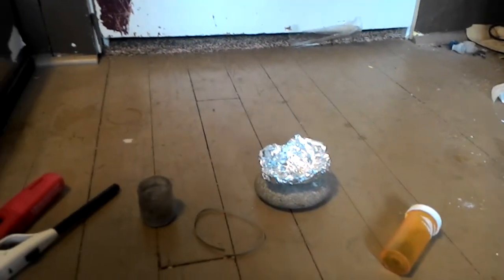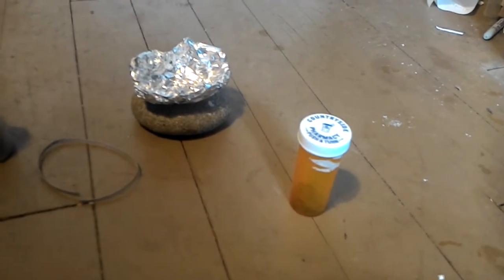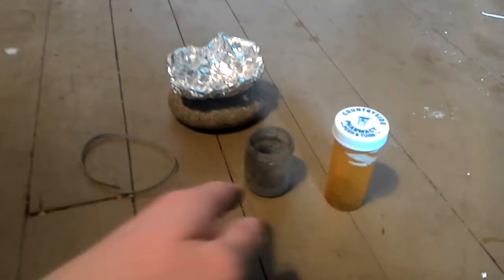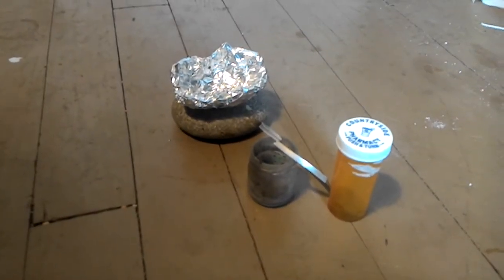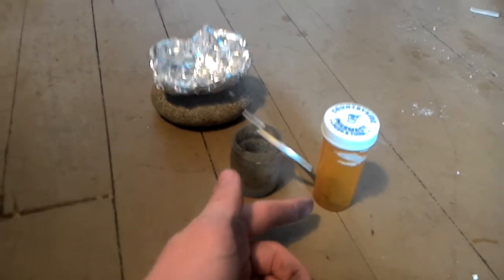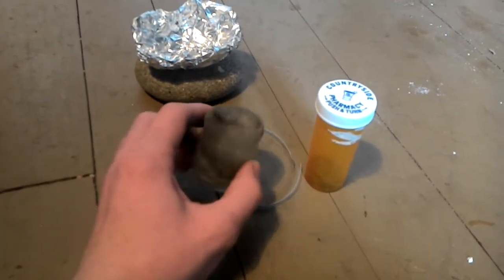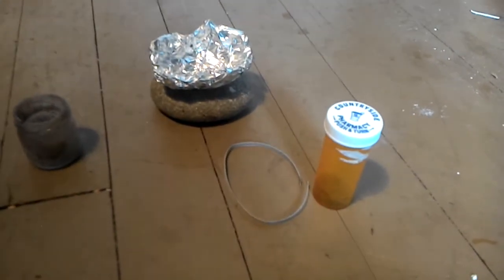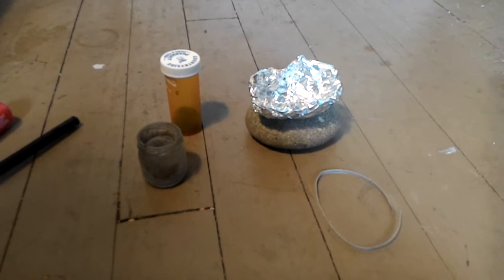I need my stand for my phone so that I can record this. Basically, what's gonna happen — hopefully, this is the plan — I have charcoal on my fingers, but I'm going to... that's essentially iron oxide. So I'm gonna try to mix it with this charcoal, and then I'm gonna burn them together using the very hot flame of this magnesium, and hopefully I'll get metallic iron out of it, because it should burn hot enough to thermally decompose this iron oxide — to rip the oxygen out of it. And while the oxygen is free, it should absorb into this charcoal making CO2, so that it can't recombine with the iron. I think the way they normally do this is with blast furnaces. I haven't looked too much into it and I don't have one of those, so I think the heat from the magnesium is gonna have to do.